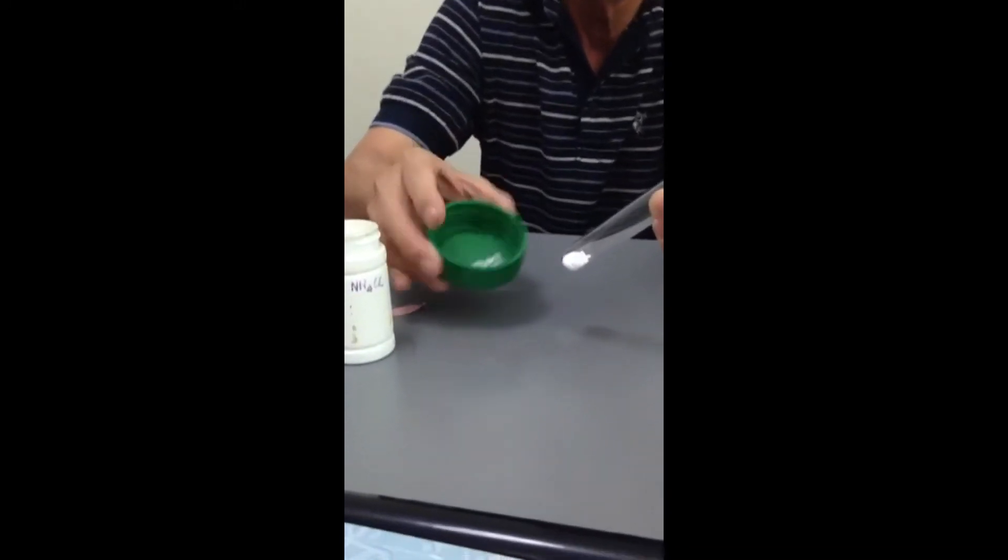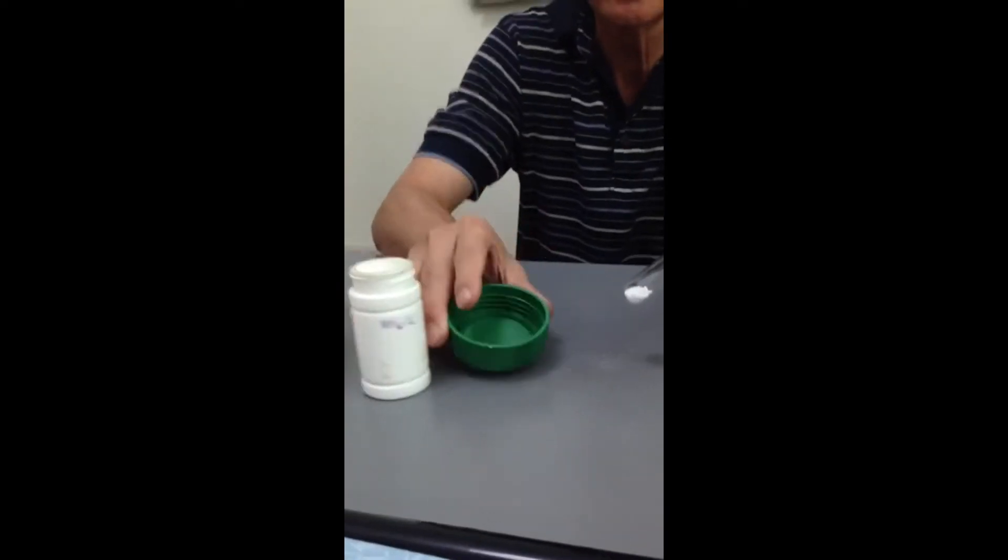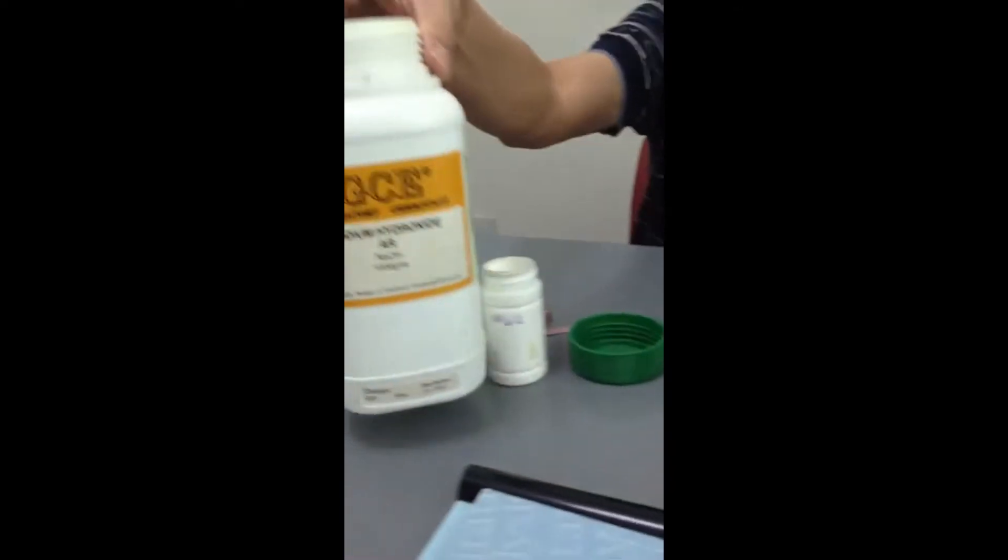Then we have sodium hydroxide. This is sodium hydroxide.